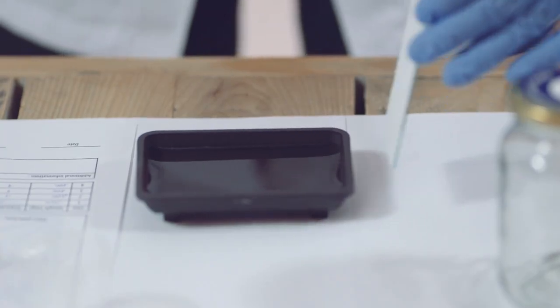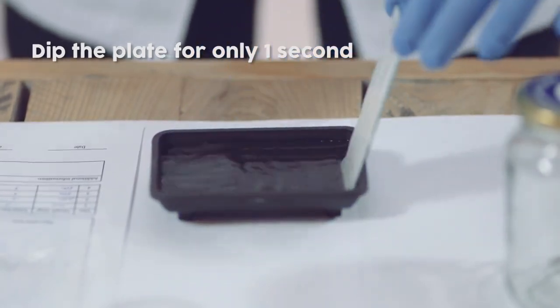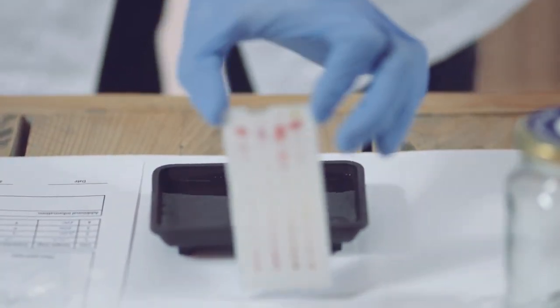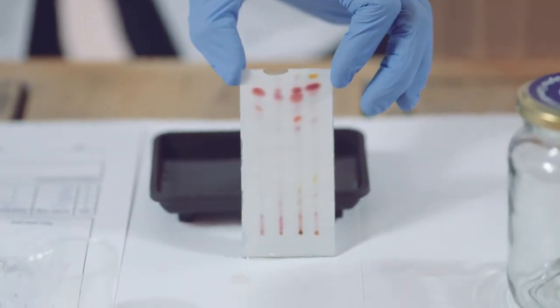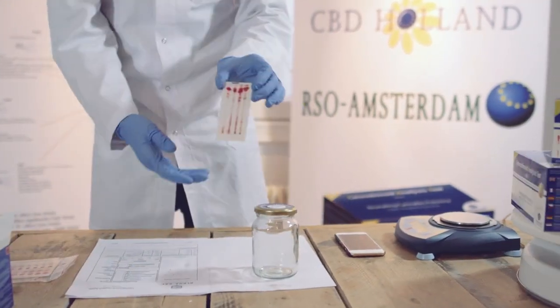15 seconds later, you are ready to dip the test plate with the coated side downwards and for only 1 second. Let the plate dry for 10 minutes and do the reading of the colored dots between 4 and 8 minutes after the dipped coloring.